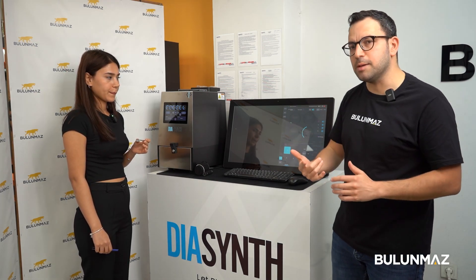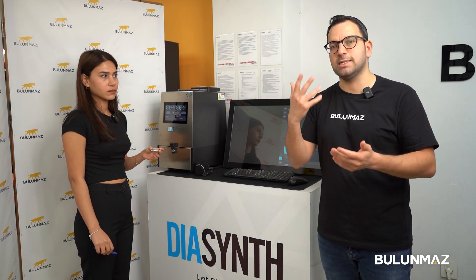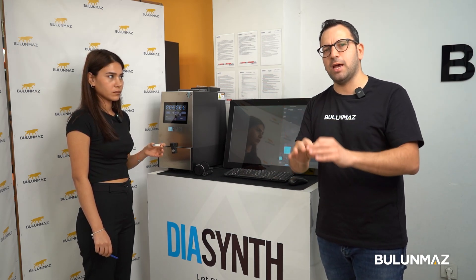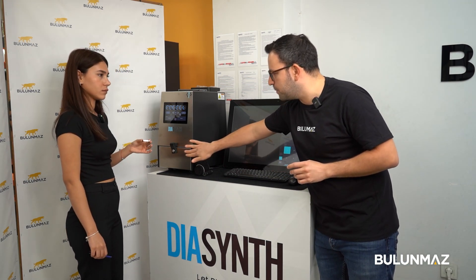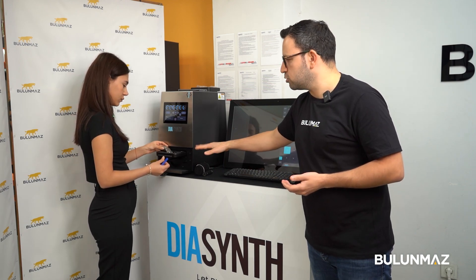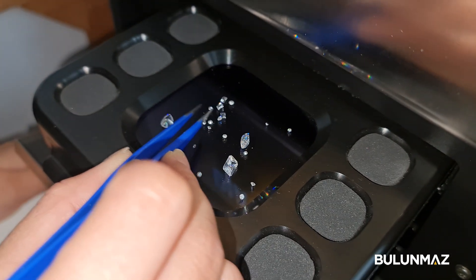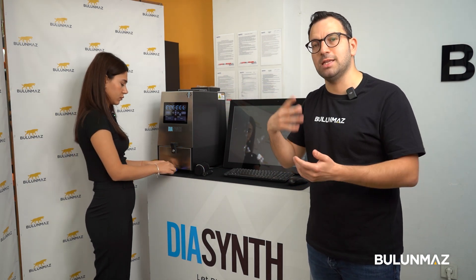When the control software is ready, the next step is to put our diamonds in. We have a mix of diamonds here — natural, zirconia, HPHT, and CVD in the slot — so we prepared it for you to show how the machine detects each of them with the help of AI. There is a basic tray; we open it manually and insert all the stones. You just open the door, pull the tray toward yourself, and put all the stones in. Make sure the stones don't touch each other so the machine can see them better, then push the tray and close it.